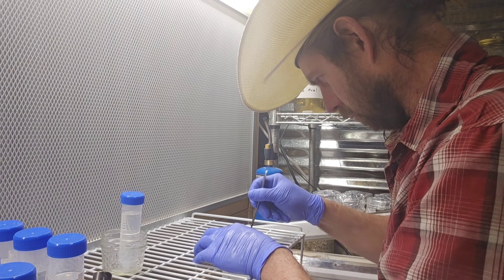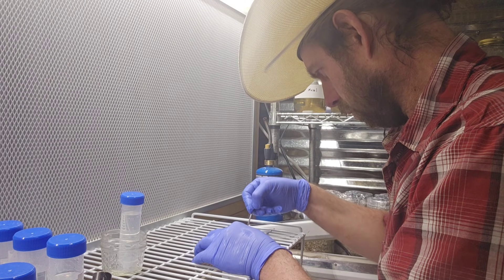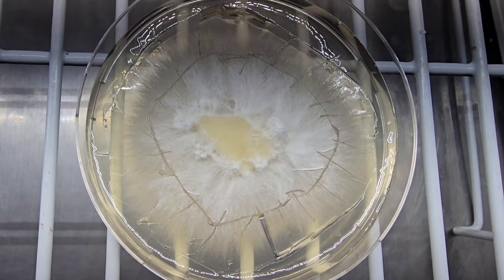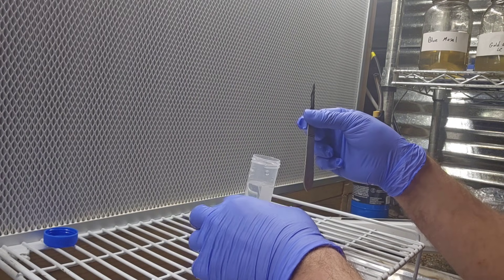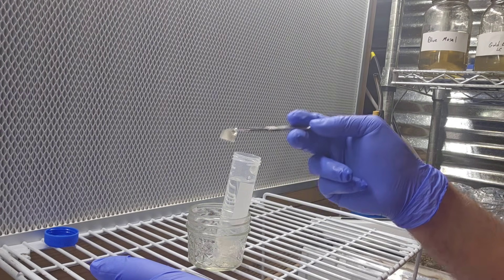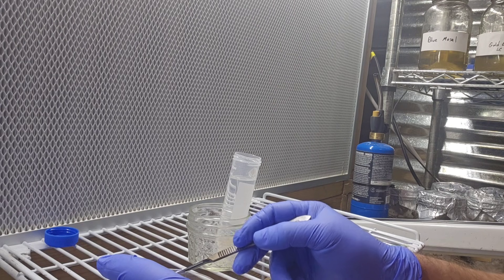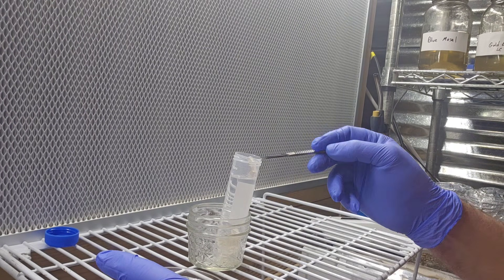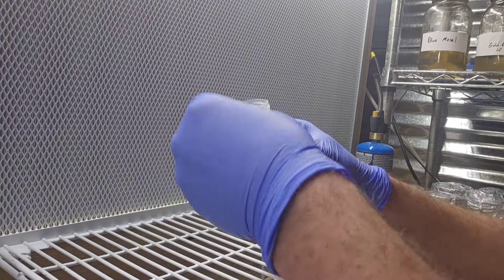I'm cutting that leading edge right now — you can see me cut a little circle. I'm going to show a zoomed-in view of this piece of agar so you guys can see exactly what I'm doing. I'm cutting a ring around it and then making little chunks. You can see I've got the little donut cut around there with little slits so I can knock out some chunks. Now I'm carefully taking the lid off my centrifuge tube and putting the tube back in the cup so I don't knock it over. Taking those little chunks of mycelium on agar and plopping them right in — put in quite a few to make sure we've got plenty of mycelium. Then put your lid back on and your culture is preserved and ready for long-term storage. Lid going on tight — give it a shake.